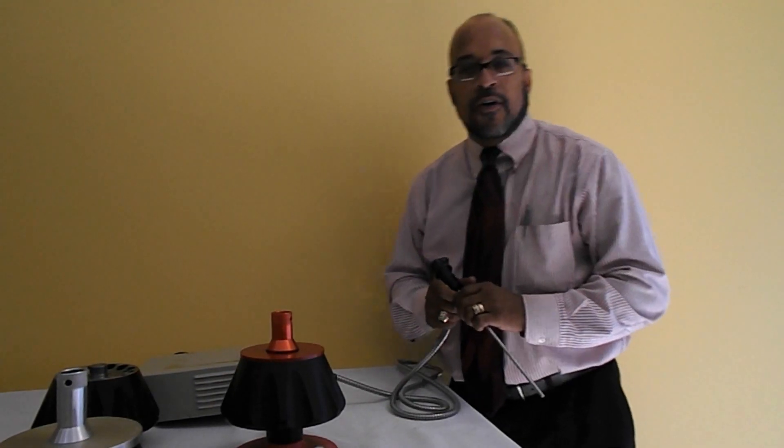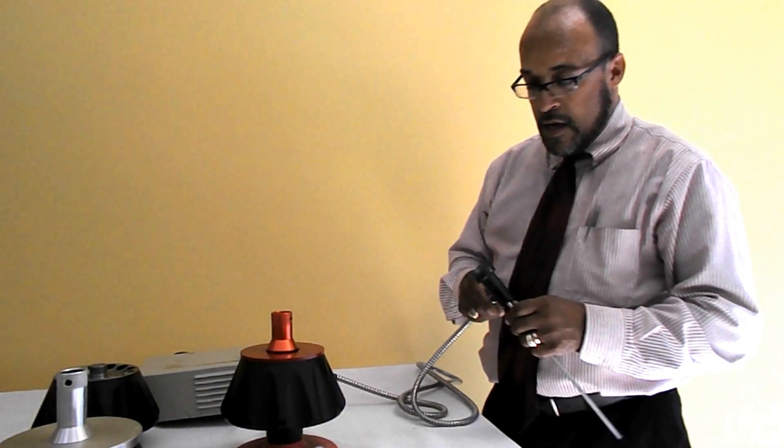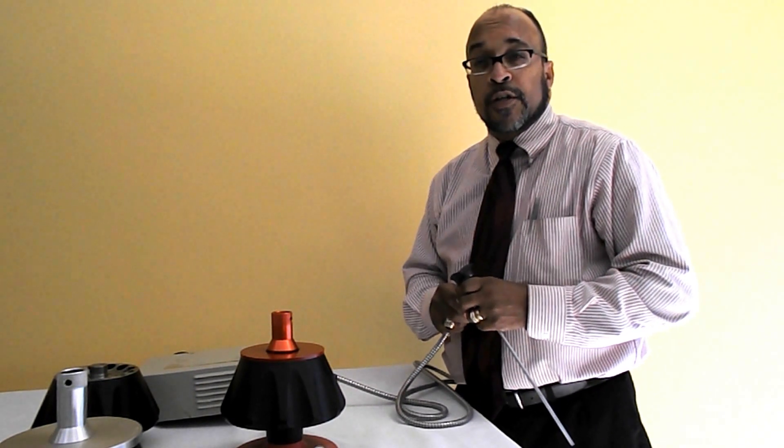Good afternoon, my name is Martin Felder from Tri-Tech Field Engineering. I am not only the technical specialist for the company, but I am the rotor inspector.